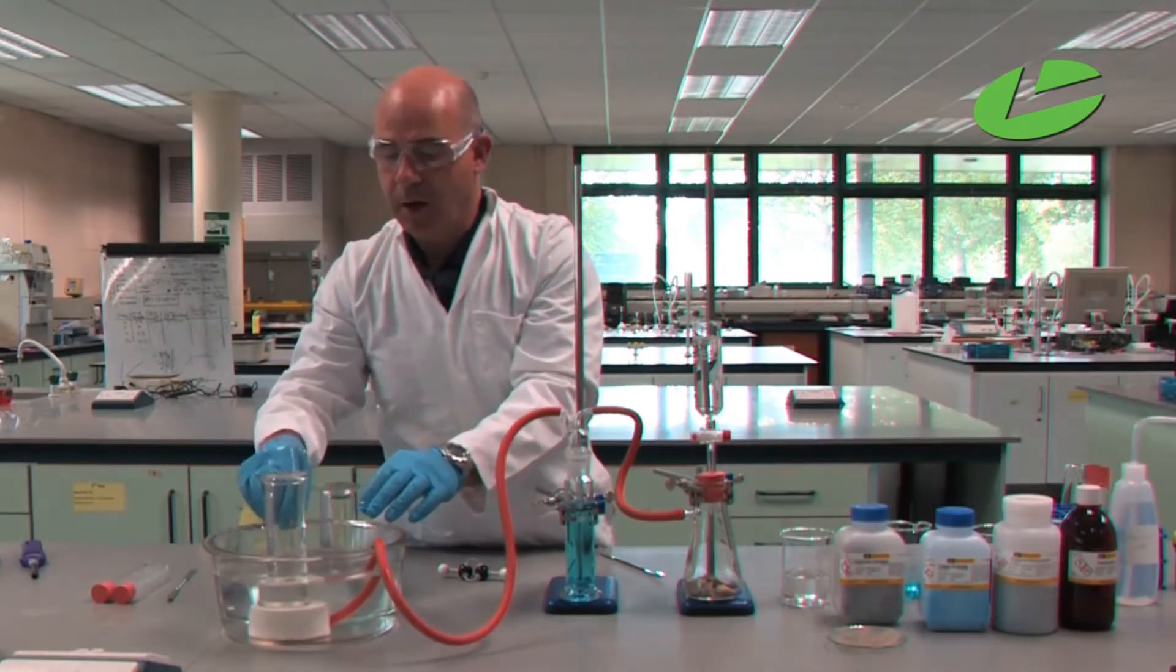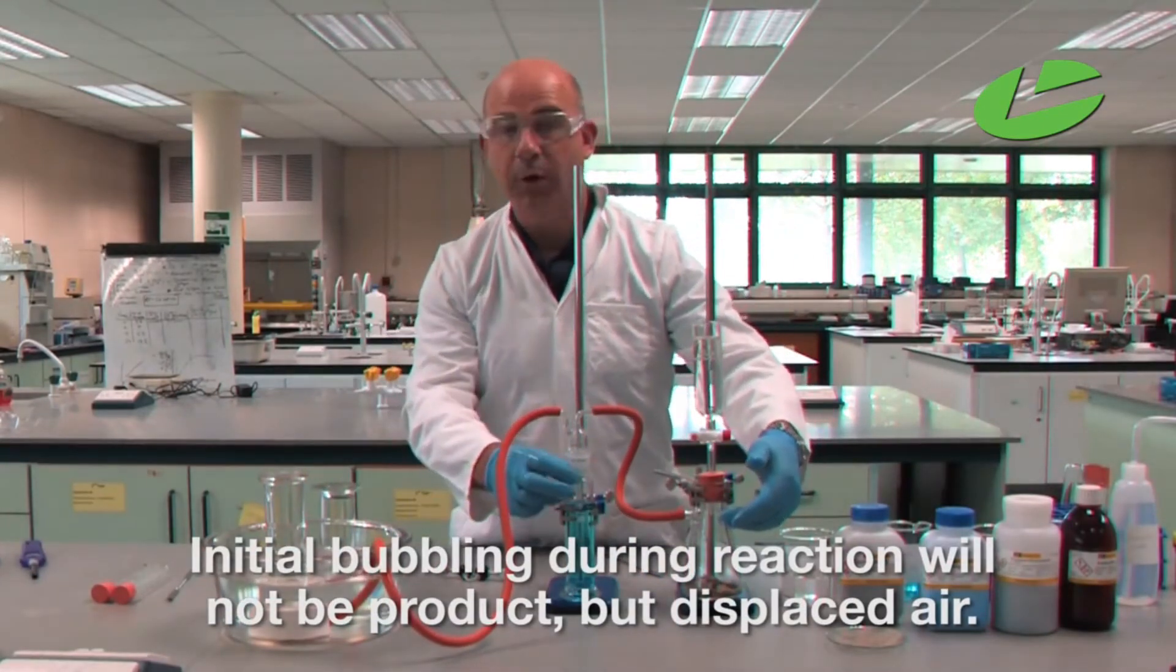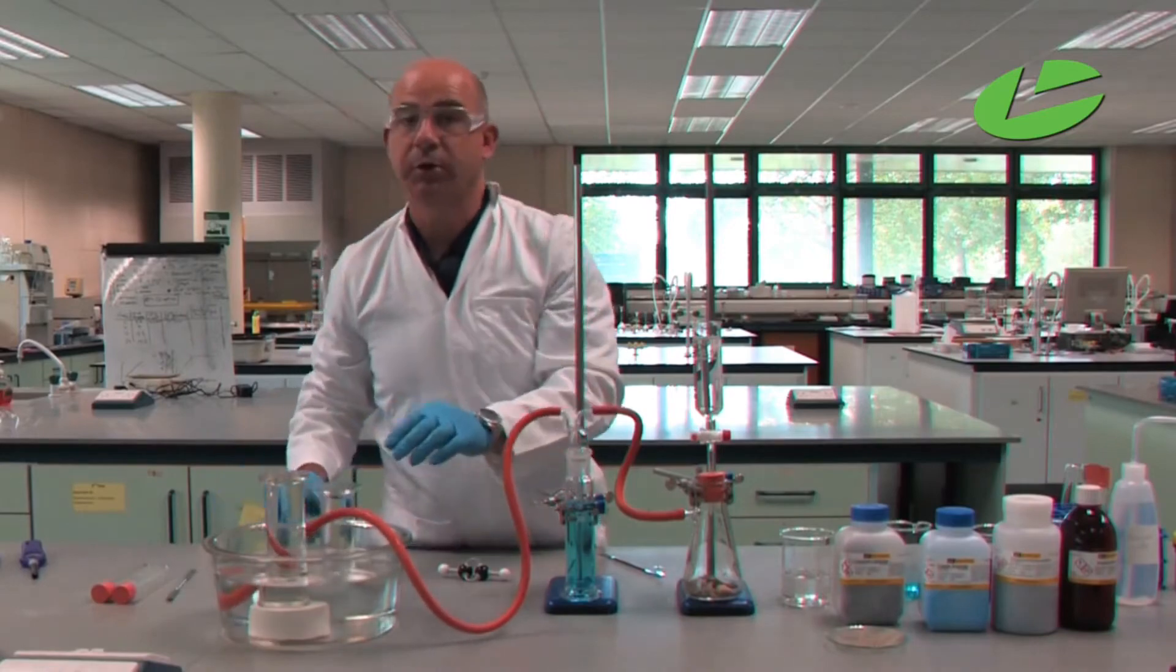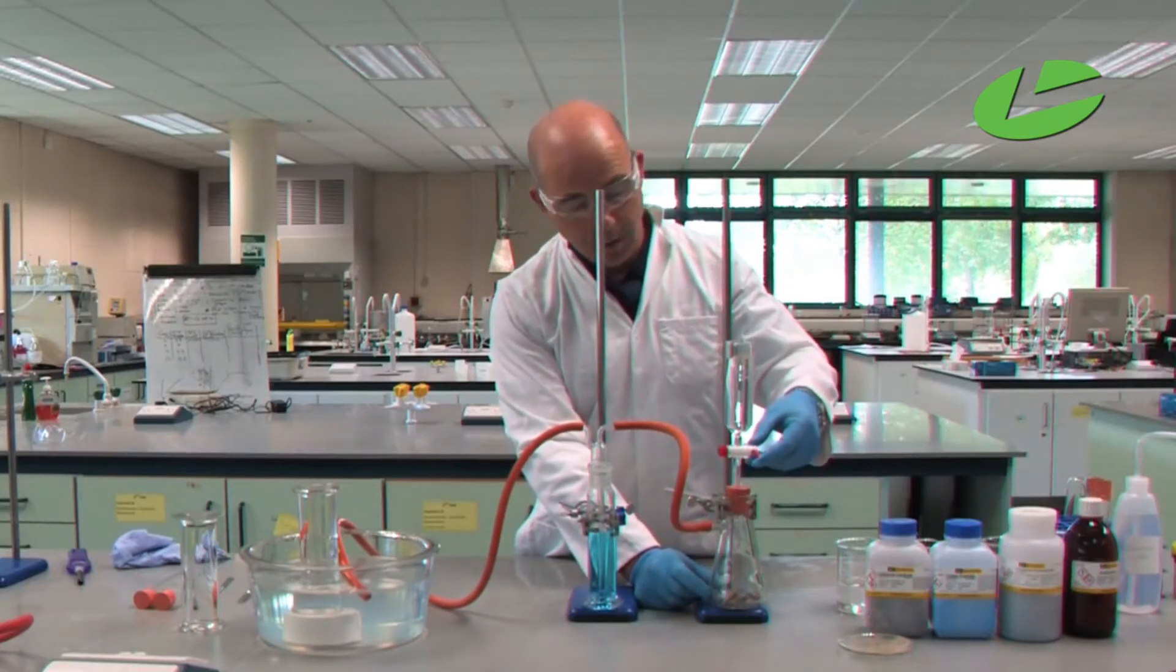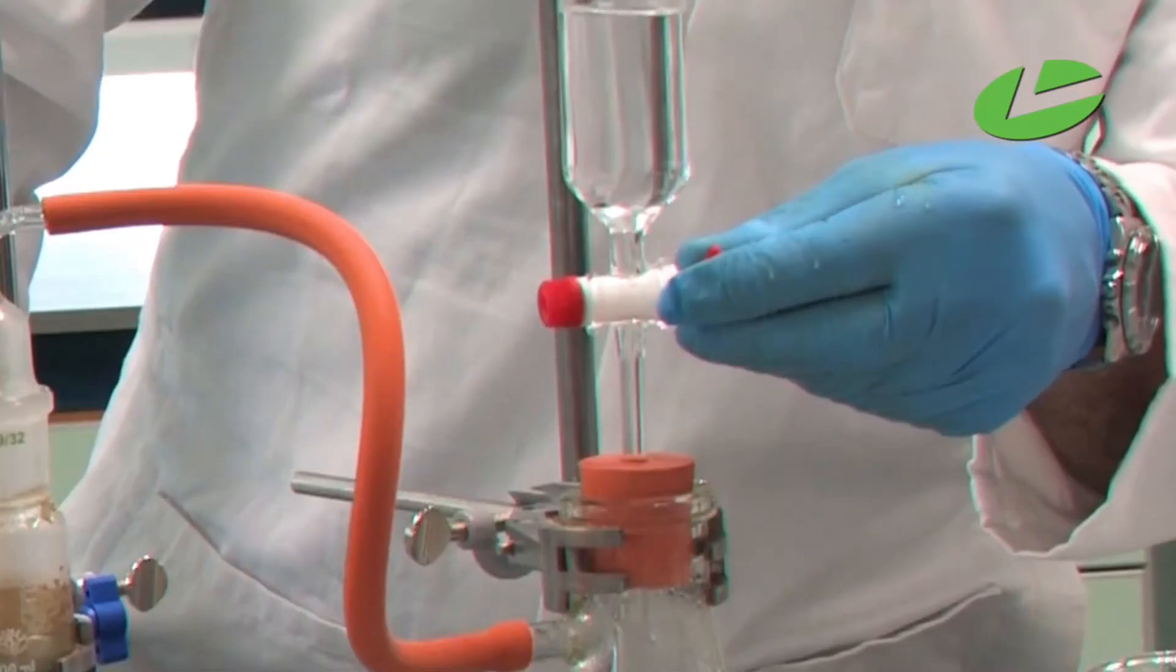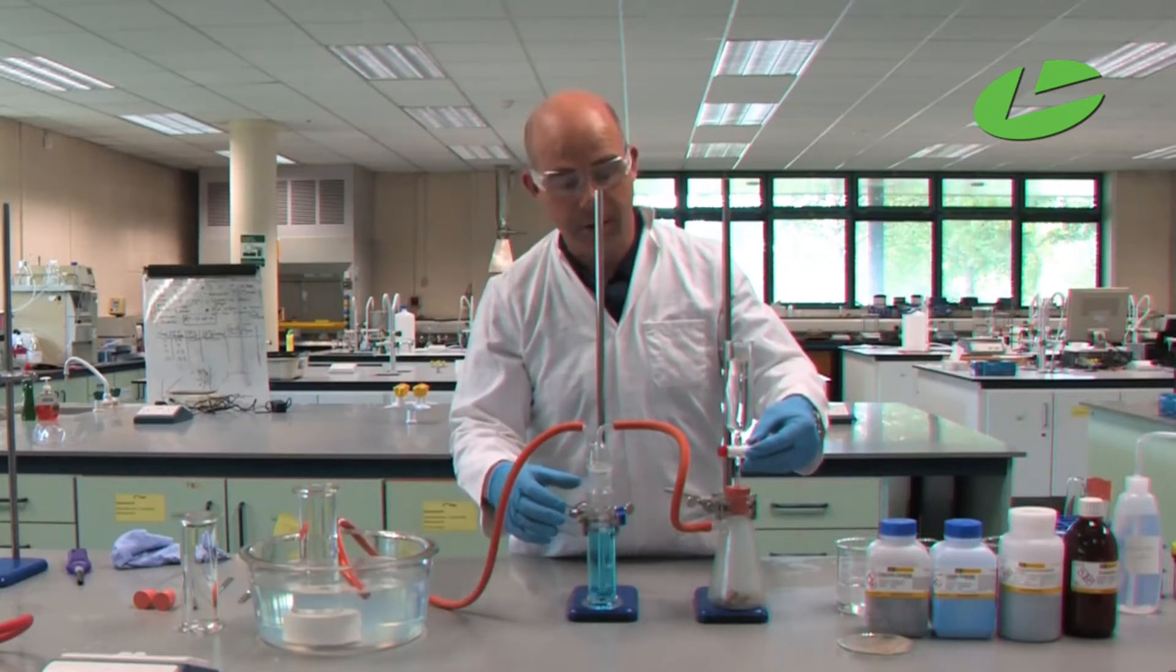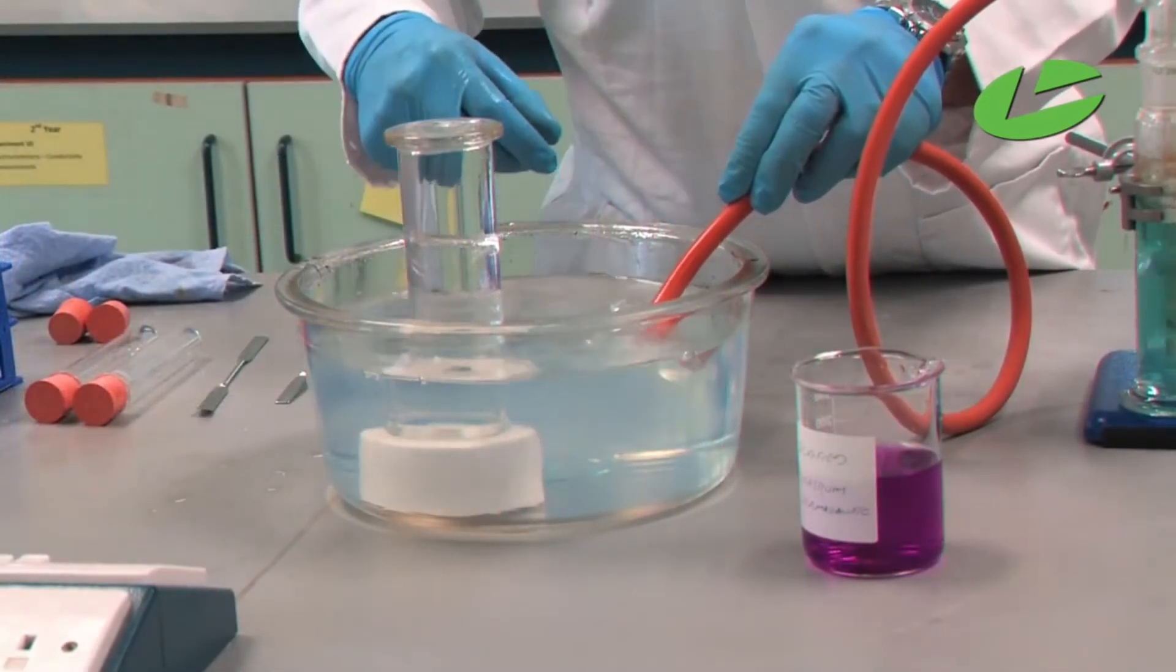If you start the reaction at this stage, the air in these voids will be displaced into the glass jar, so remove the tube until you're ready to collect the gas. When you open the tap, water drops onto the calcium carbide (CaC₂), producing ethyne gas and calcium hydroxide as a byproduct. Gently let some water into the container and you'll see bubbles produce quickly. These initial bubbles are displaced air that we don't collect.